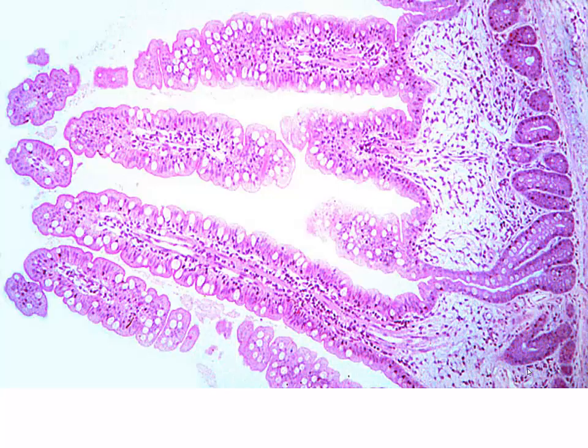Again, a nice view of ileal villi. And again, we can see all those components extending down. We can see a nice view of our crypt of Lieberkühn as it's coming in, even branching out at this point. And then the goblet cells on the surface. And there we have a nice example of a lacteal in the middle of that villus.